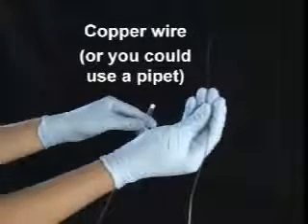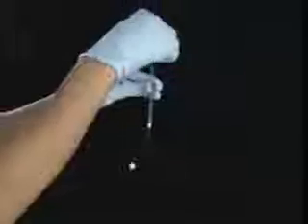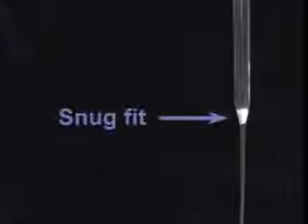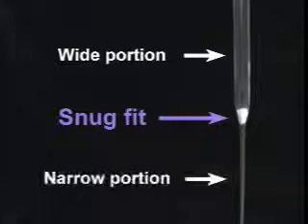Place the cotton ball there. You can use either copper wire or another pipette to stuff down the cotton. With a few jabs, it should be nicely wedged in there. You want to firmly pack it down so it enjoys a snug fit between the wide portion and the narrow portion of the pipette.